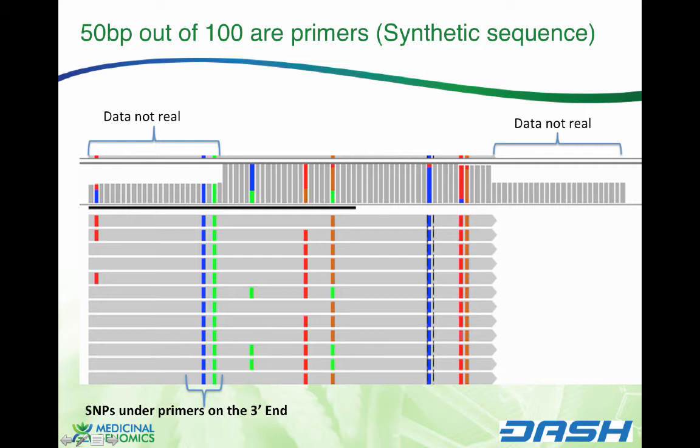So only these ones really reflect what was on the reverse complement strand of the polymerized DNA sequence. Likewise, when you run into this direction, you start hitting the reverse primer, this data should also be thrown out. So in here, 50% of the data delivering is thrown out, and the 50% of the data in the middle is marginalized because it was derived by primers that potentially could sit on SNPs, and you may be only looking at one allele. Here you can see there's a couple other alleles that are showing up, but sometimes 3.